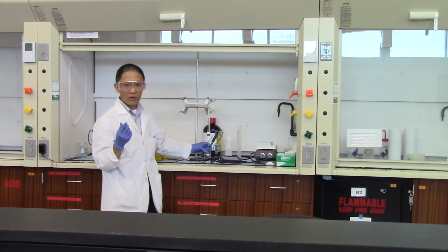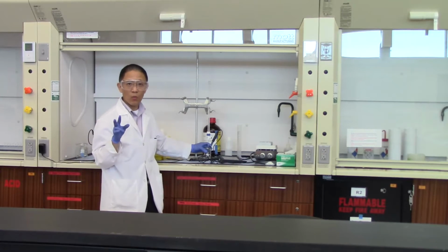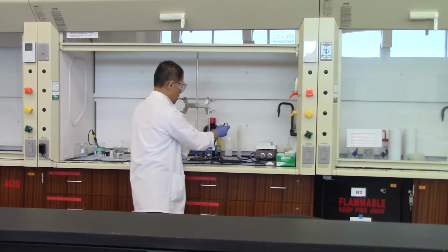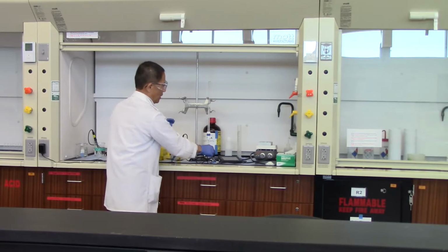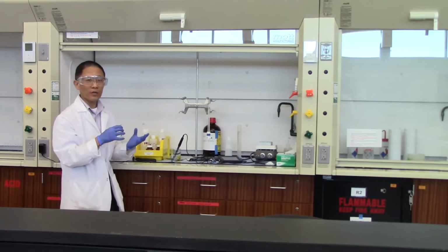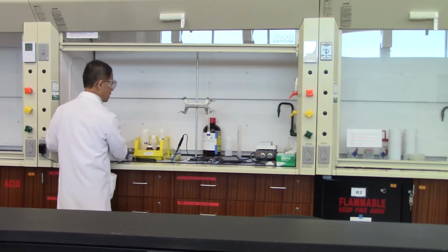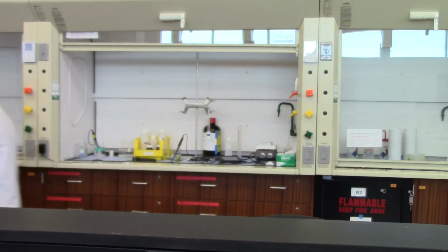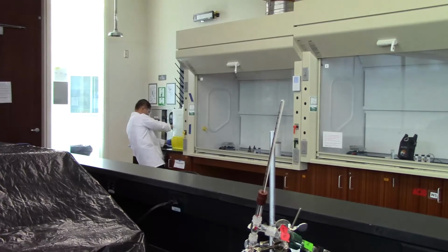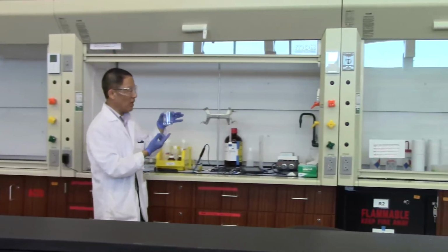Okay? And we also want you to compare between buffer A and buffer B, as well as between buffer and pure water. So we will do a quick demonstration of the buffer capacity for the pH change of water. We will get 25 milliliters of water. We can use another beaker, and we will get some deionized water. So this is roughly 25 milliliters of the deionized water.